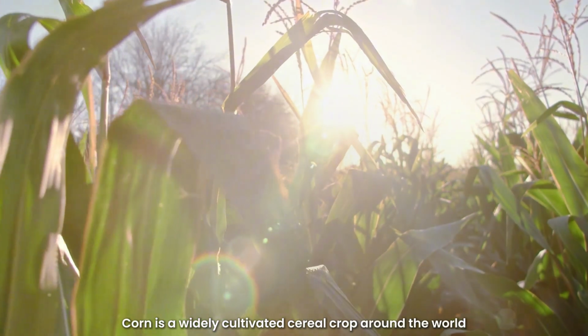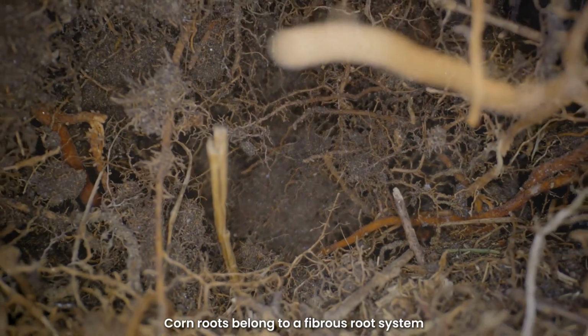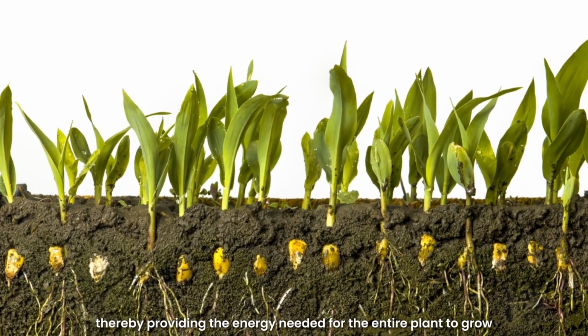Corn is a widely cultivated cereal crop around the world. Corn roots belong to a fibrous root system, which is extensive and capable of absorbing large amounts of water and nutrients, thereby providing the energy needed for the entire plant to grow.